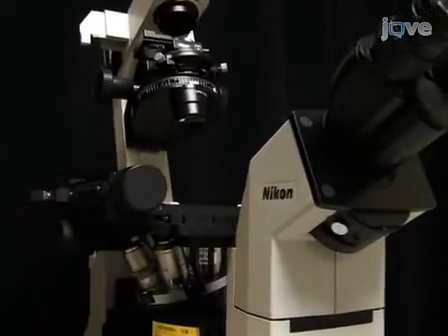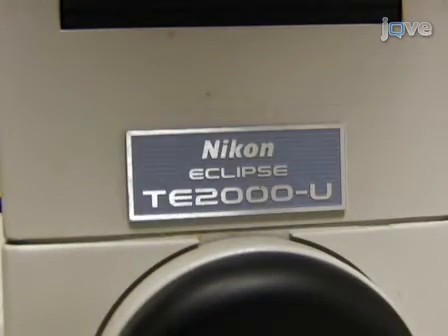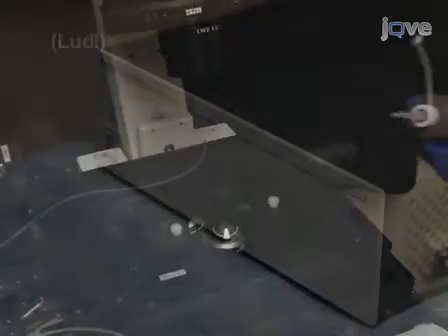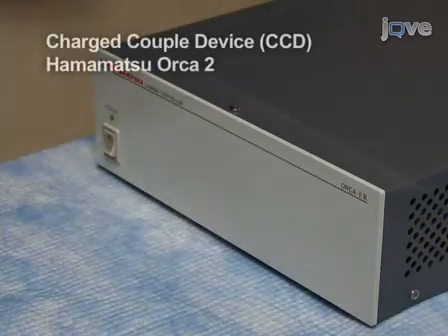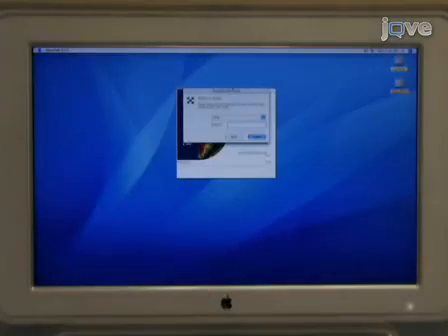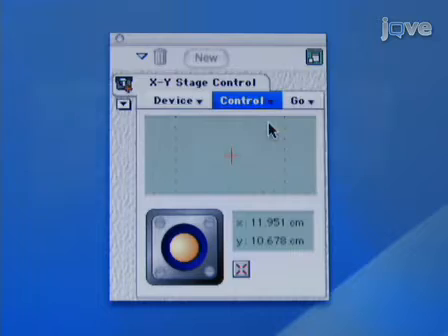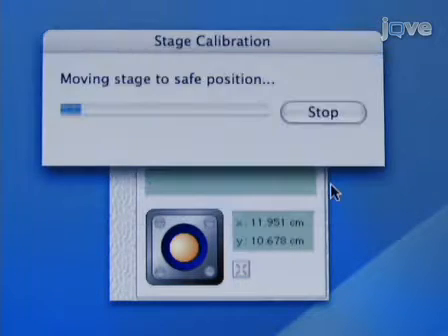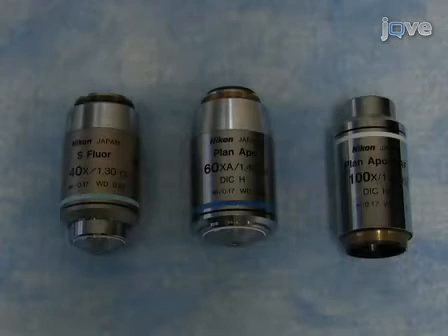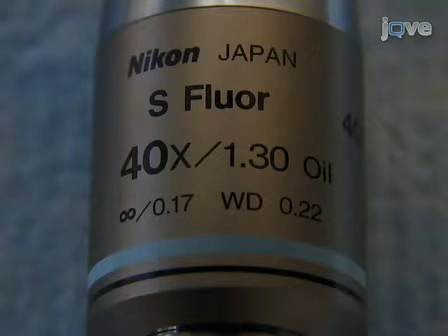For calcium imaging of cells, we use an inverted Nikon Eclipse TE-2000U microscope equipped with a xenon arc lamp, an automated stage, and a cooled charge-coupled device CCD camera. The microscope is controlled by a Macintosh computer running OpenLab software. To begin imaging, calibrate the automated microscope stage. Then place a drop of oil on the objective. For imaging, we use 40x, 60x, or 100x Nikon oil immersion objectives with an NA exceeding 1.2.